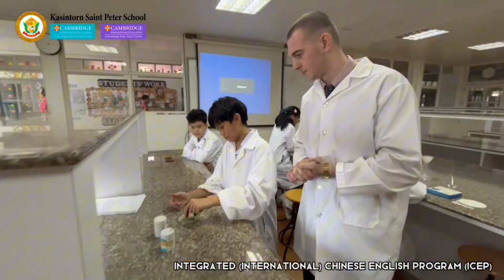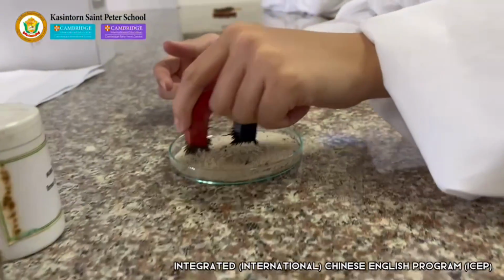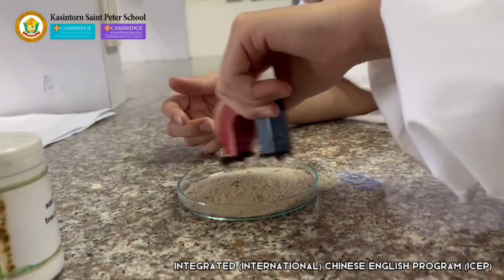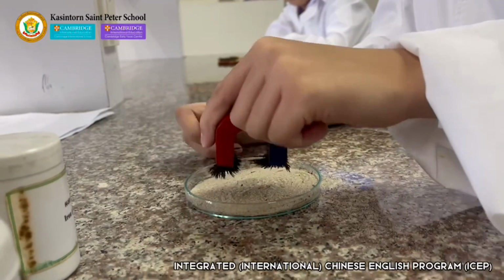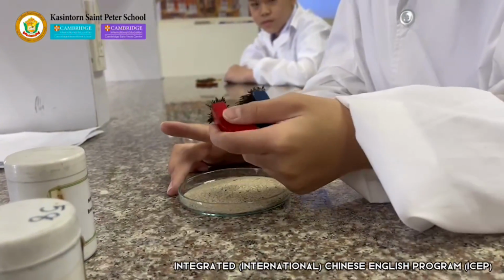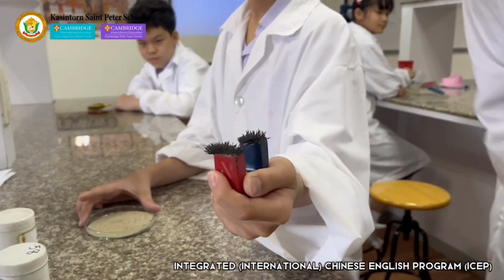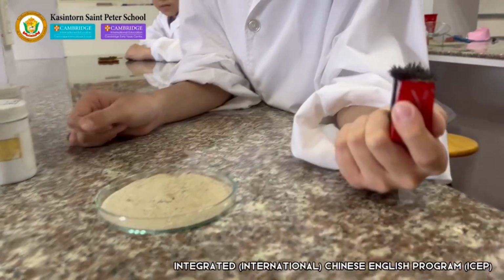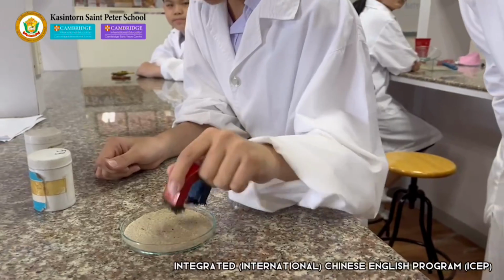Let's see. Wow. So you can see here that the iron filings within the mixture of sand and iron are being attracted to the magnet. This is because iron is magnetic while sand is not magnetic. Okay, Keen, why don't you show the magnet? Wow, you can see all of the iron filings are stuck, while here we can see that the sand now has no more iron filings, or at least not many. That's perfect, Keen. Thank you very much.